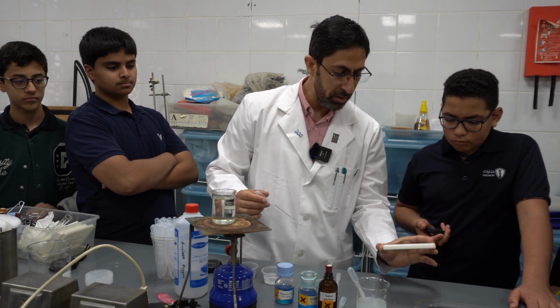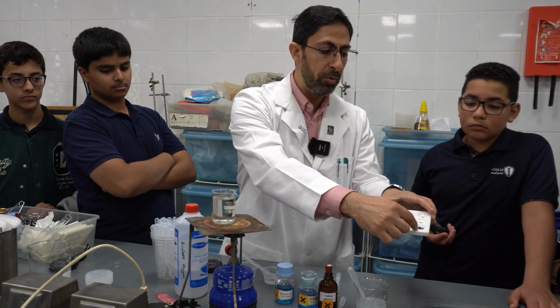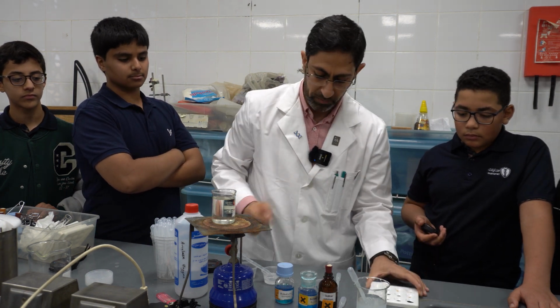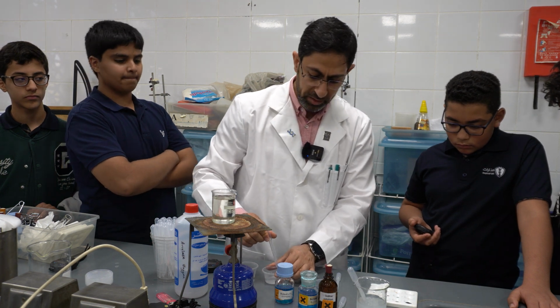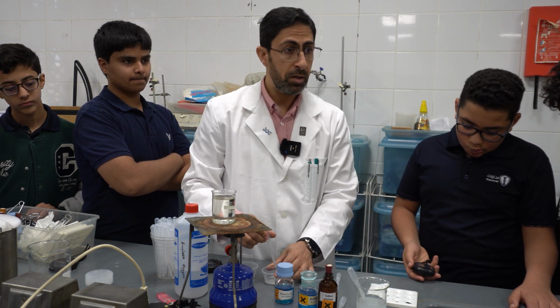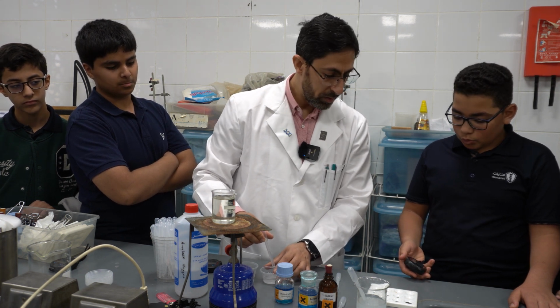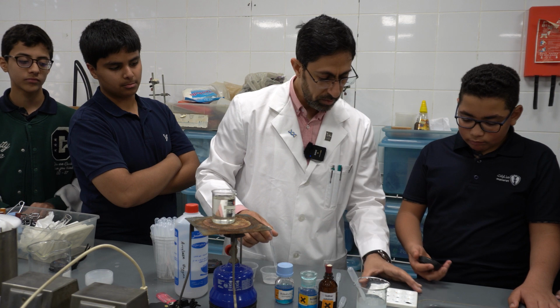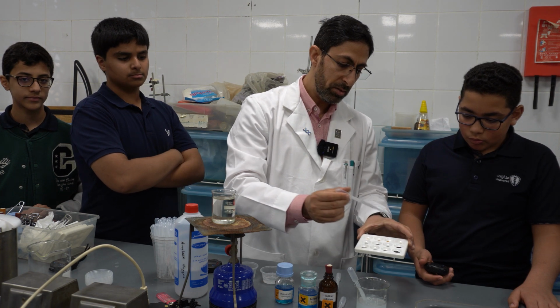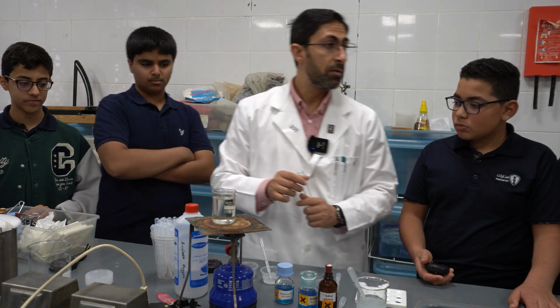Yes, it is lighter, even lighter. That's very good. As you can see, there is a big difference in the concentration of the blue-black between when there is no enzyme and now, after I can say 1, 2, 3 minutes. I think 3-minute intervals is okay. So we can now test the presence of reducing sugar, or the disaccharide maltose. But let's give it another minute. After 30 seconds, tell me. Okay, much lighter. So now it's time for testing the presence of the reducing sugar.